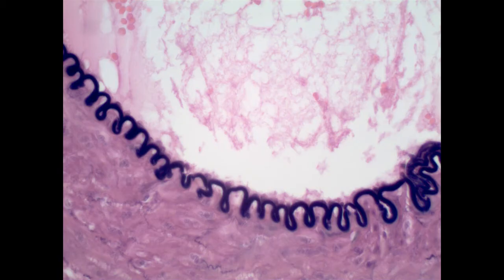Here, this is a blood vessel. This is the example we have for you in lab. We know there's a few things we can see here. There is blood, and these are red blood cells. That's a nice feature to tell us that this is in fact a blood vessel. This would be the wall of the blood vessel, and this is the center where the blood passes. We are looking for the innermost layer of a blood vessel. That is where we find simple squamous ET. There are a lot of other places in the body that you should be familiar with, but the example we have in lab is the inner lining of blood vessels.